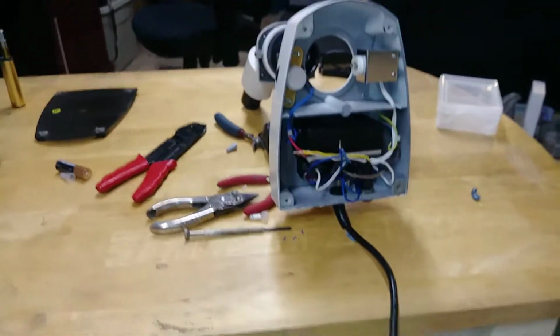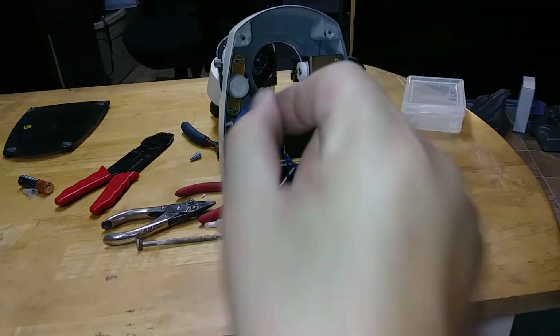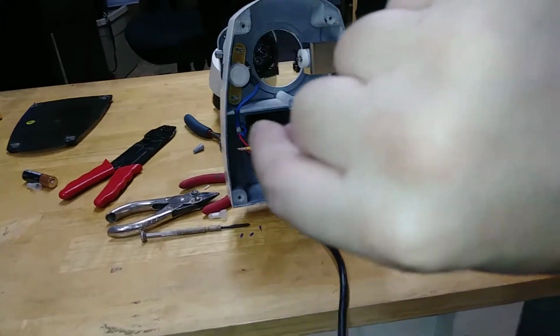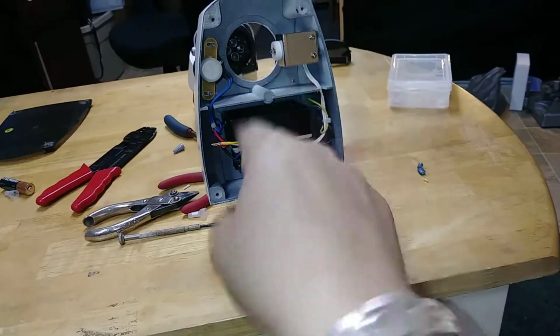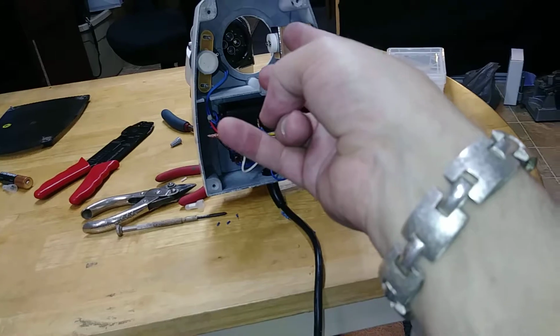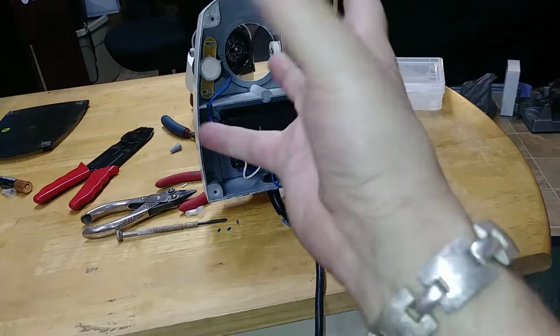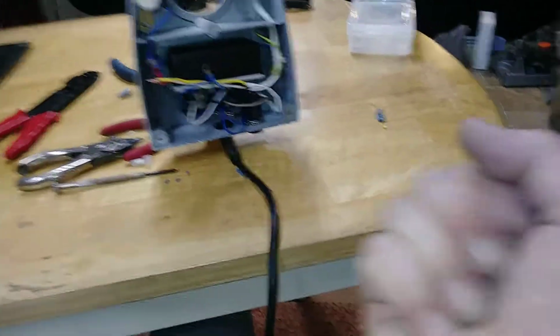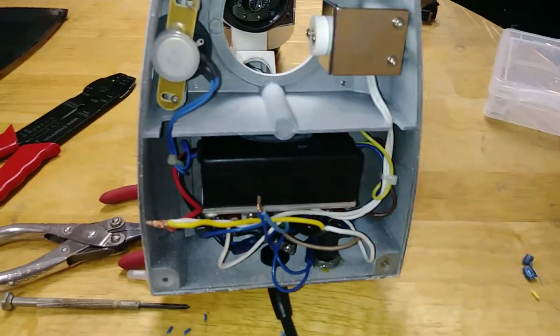If anyone's got some comments or some suggestions of what's going on so I can fix this scope, please, by all means, let me know, because it doesn't matter whether you stick the bulb in this way or pull it out and stick it in this way. A terminal is a terminal to the bulb. But for some reason, the voltmeter is registering voltage one way, but not the other, which is causing a short. But it's not showing a short, because if it was showing a short, there would not be voltages in certain places.